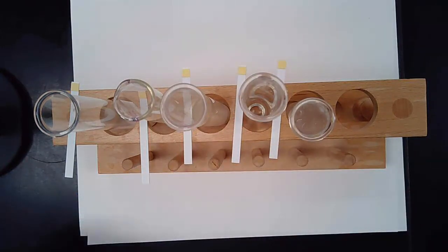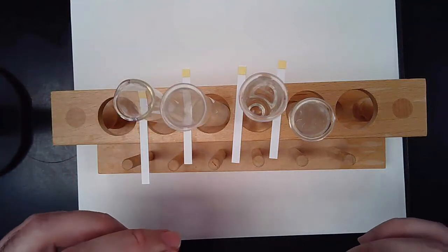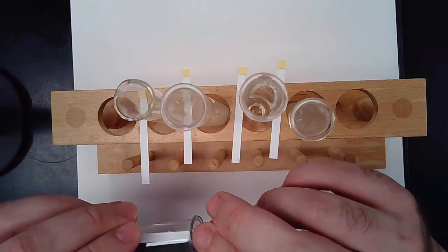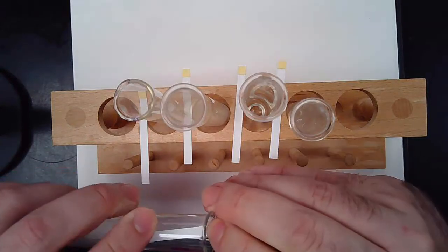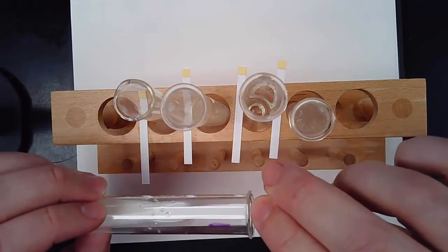And what I'm going to do now is take each one of these test strips, and take the test tube and just tip it a little bit. And I've already poured milk, not that that happened, all over my table once. So I'm just going to carefully turn it to the side. And if you can see what I'm doing, I'm just turning it to the side and submerging the strip in the milk.